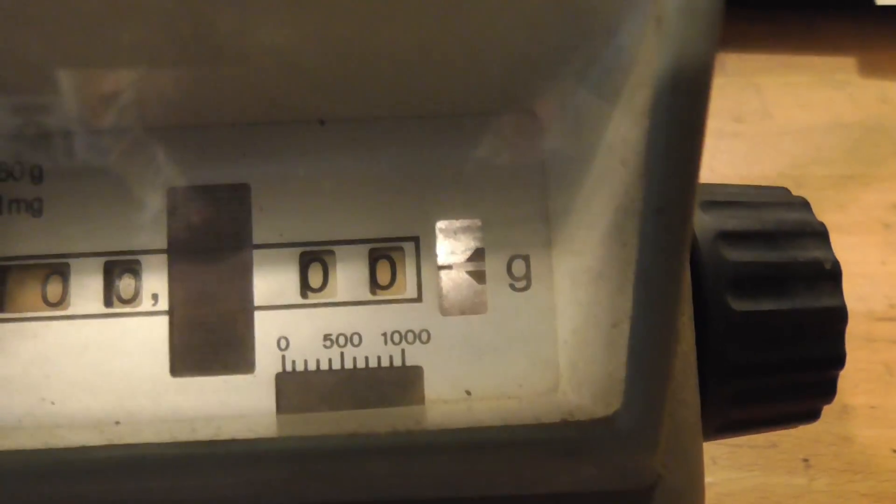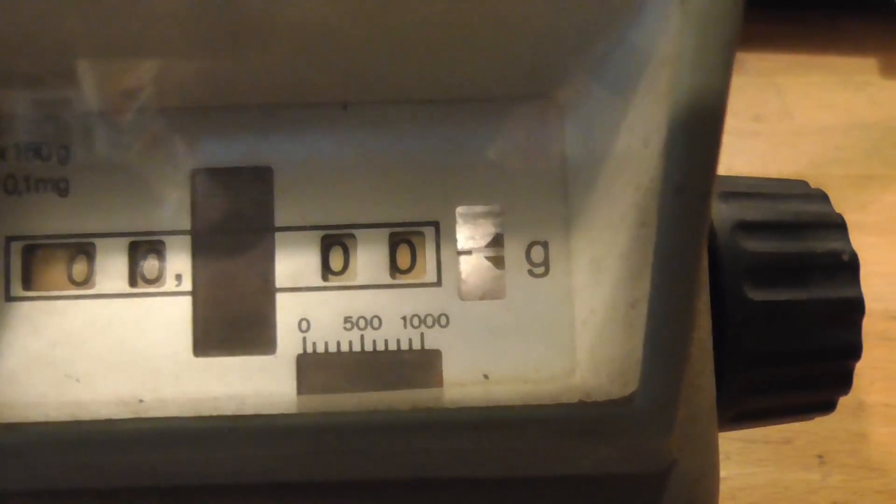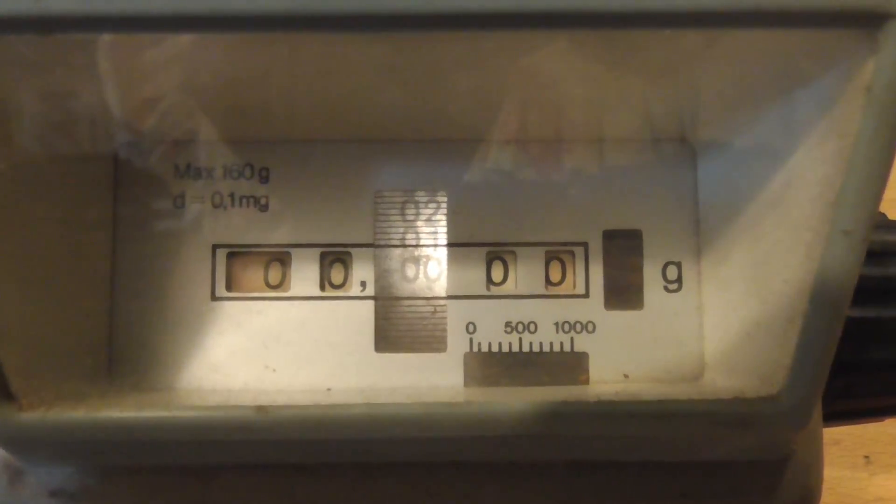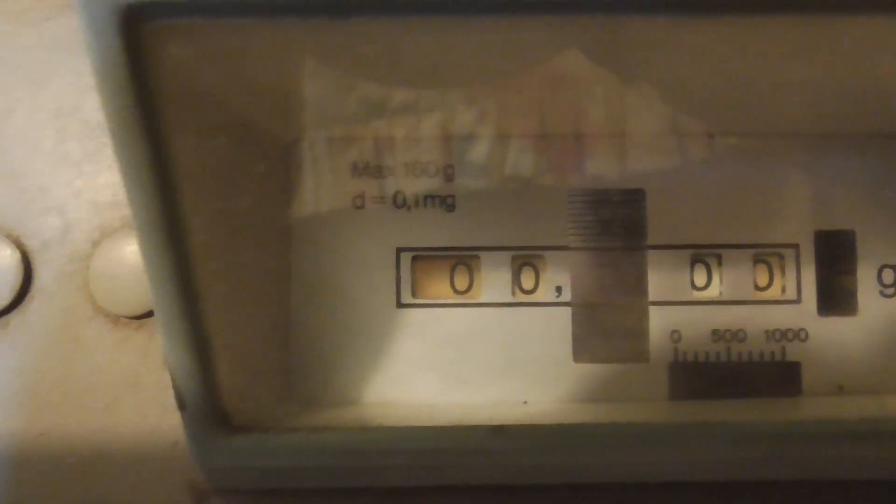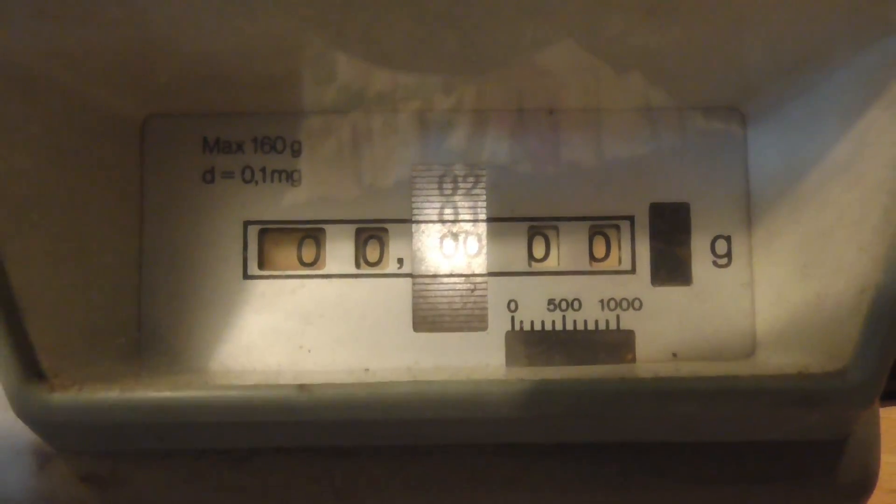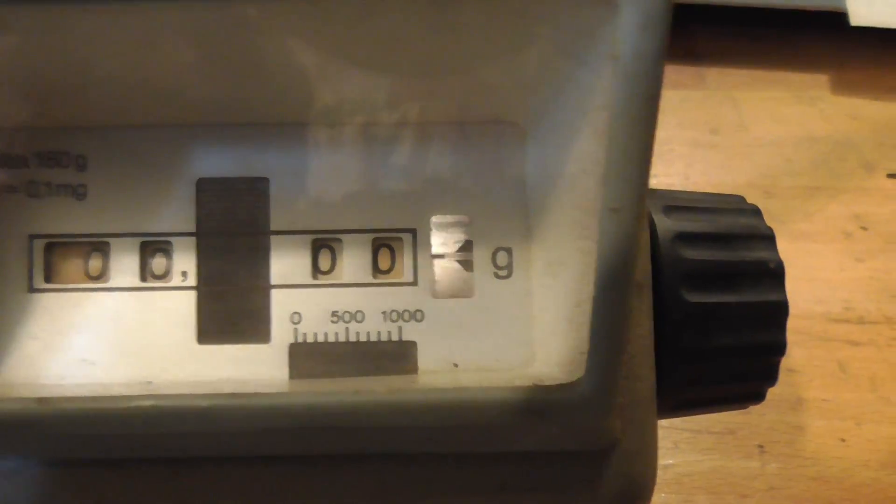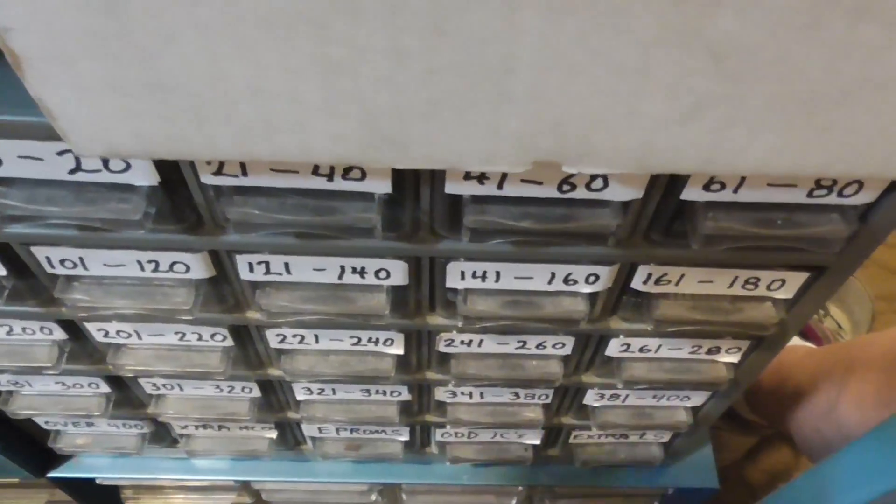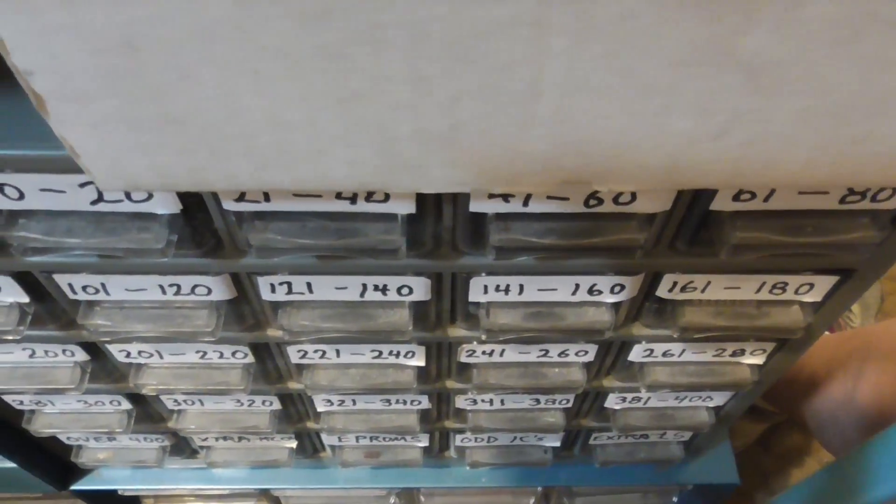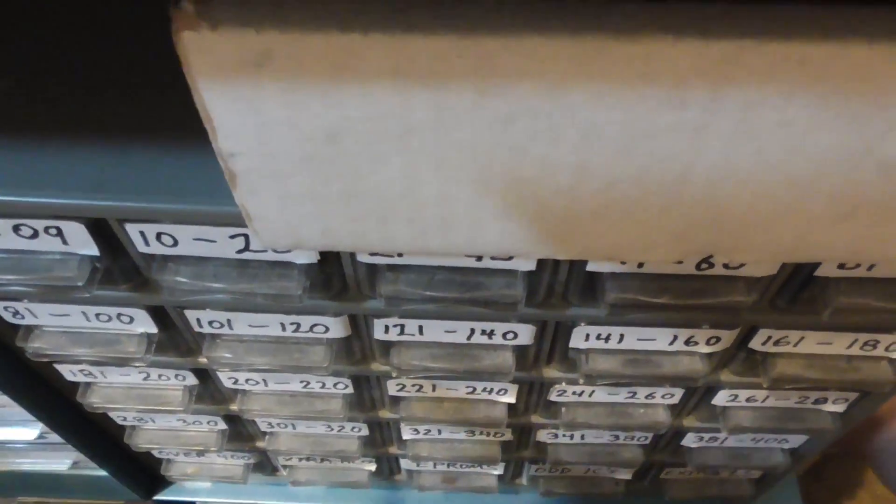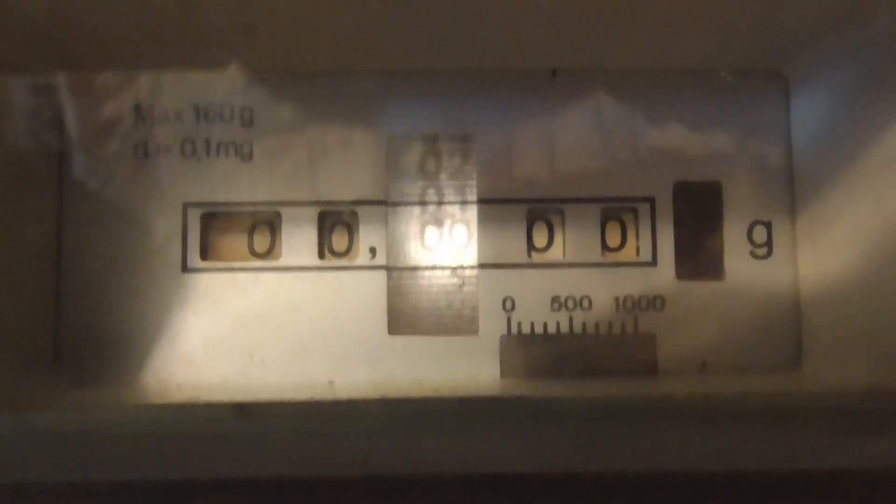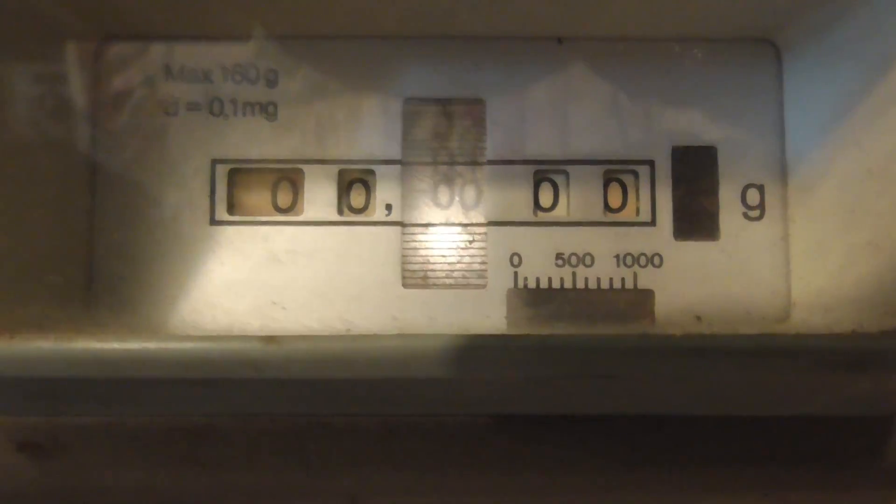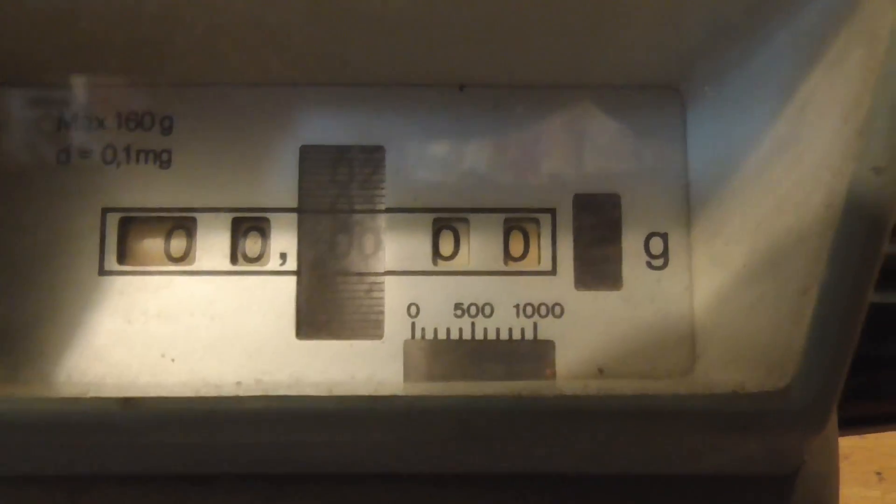I don't understand why - isn't that the craziest thing? Why the camera only has sensitivity in that one little area? Everywhere else it looks good. It has even sensitivity all the way across. We don't see any change in sensitivity. But if we go down here, and we look at that scale, there's definitely only one spot there where it has real sensitivity. So what we're going to do, we'll go ahead and we're going to put a piece of paper.